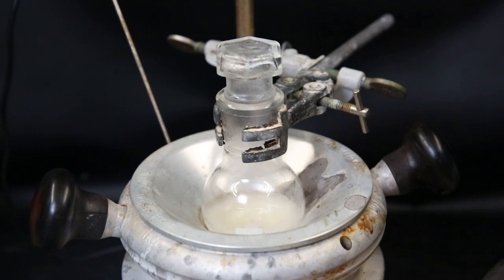Now, since there was a yellow impurity, I moved it all into a smaller flask afterward and washed it with 5% ethyl acetate in hexanes. Since we know the product is poorly soluble in this mixture, we can use it to get rid of the impurity.